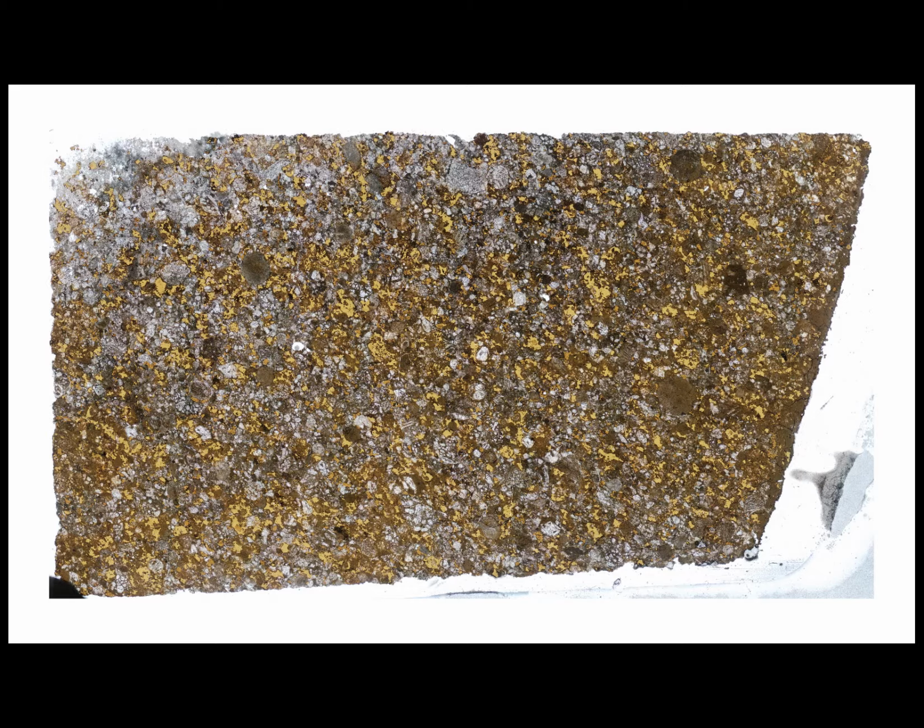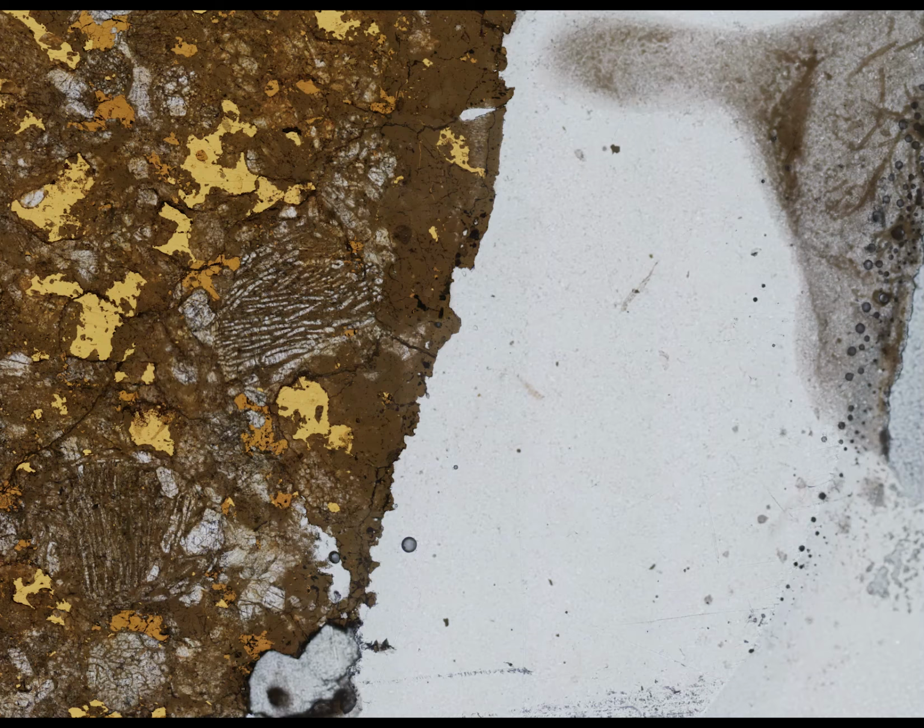So of course the next thing to do is to increase the magnification. So here I've bumped things up to 10x magnification. And now we can begin to see some of these really interesting details. There are a couple circular regions with unique textures, some grains that are an amalgamation of multiple minerals. You can really see that melted molten material starting to coalesce into this solid asteroid body.